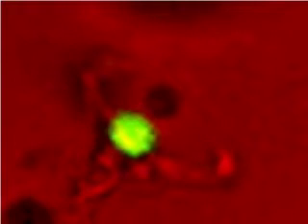Eventually, the T cell loses interest. While it is still contacting the dendritic cell, you can see the fluorescence start to fade. The T cell will eventually migrate away from the dendritic cell.